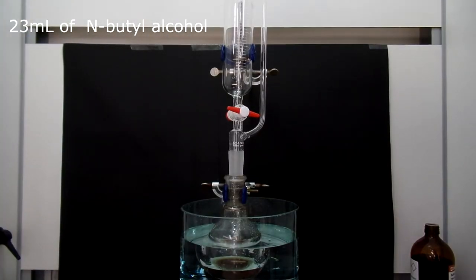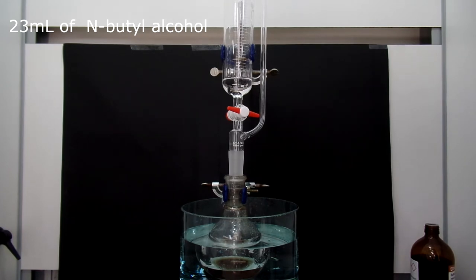Next, 23 ml of n-butyl alcohol is added dropwise. I used the dripping funnel, and you can see that I didn't fully joint the dripping funnel because the joint was hindered by the slurry silica sulfuric acid.